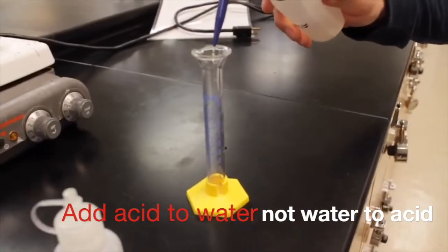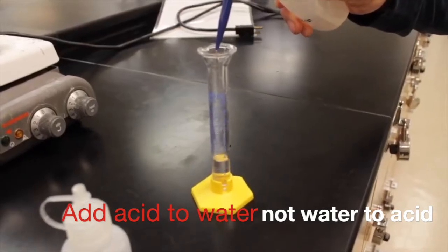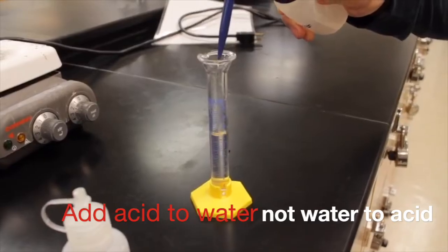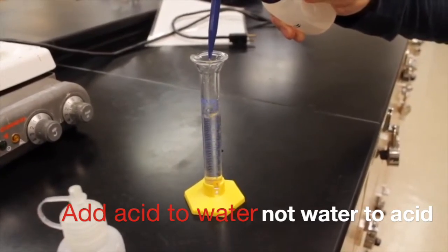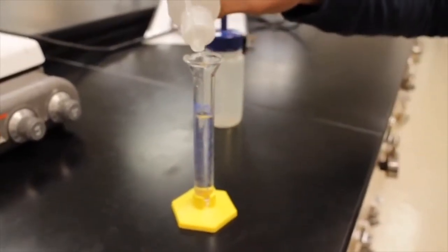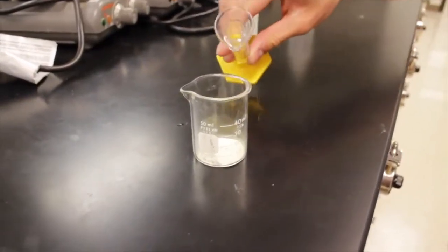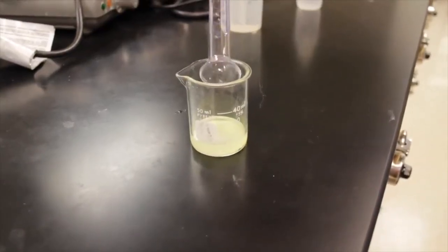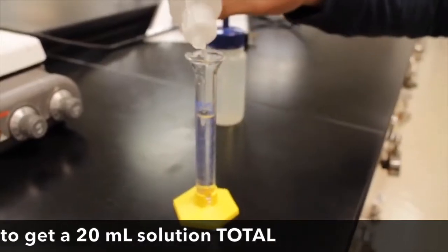In order to make a 0.1 molar solution of HCl, use 1 milliliter of 1 molar HCl and 9 milliliters of water. Remember, you always add acid to water, not water to acid. Pour the HCl solution into the 50 milliliter beaker. Do this twice. You should have a 20 milliliter solution at the end.